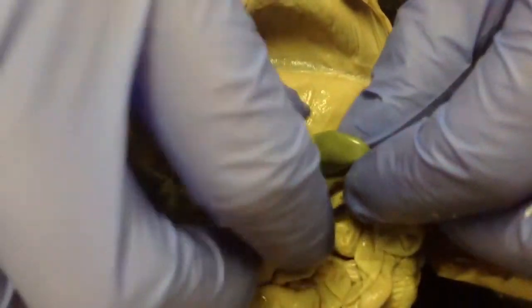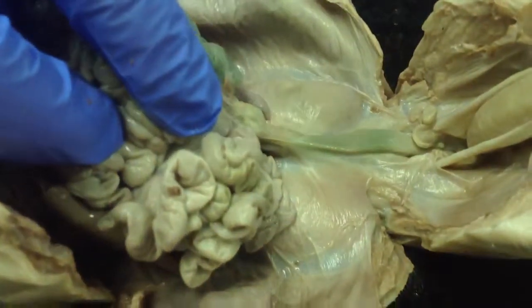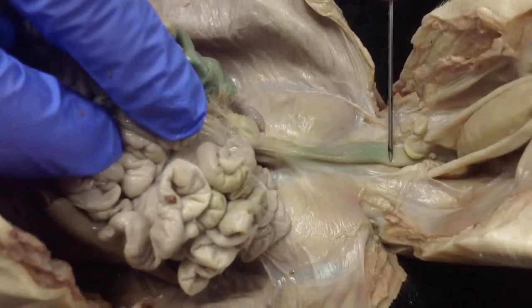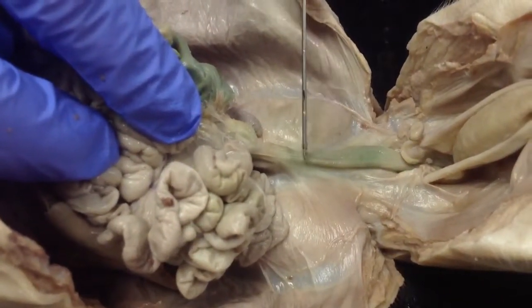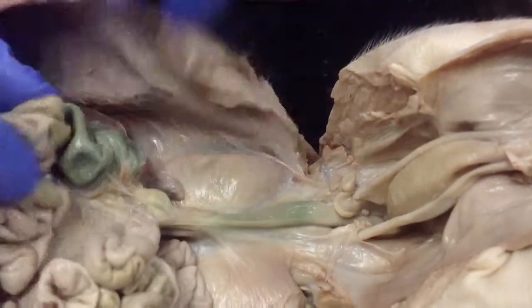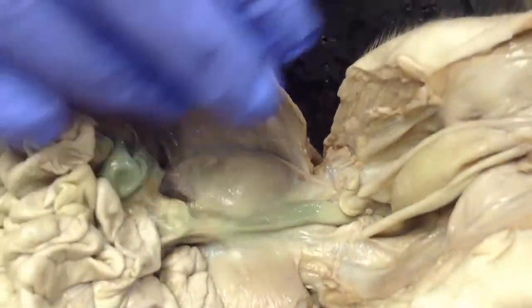Okay. Now moving through, if you follow the large intestines, this structure right here, that is the end of the large intestines, which makes up the rectum. So that rectum is going to lead right outside to the anus where the food can be passed. Okay, also to note, we're going to come down here.